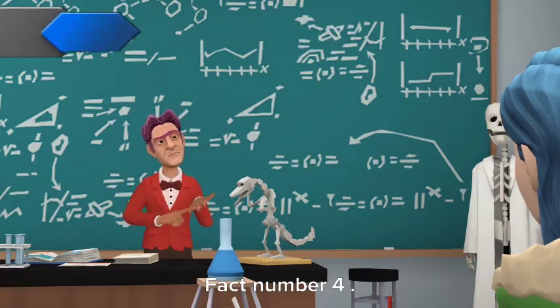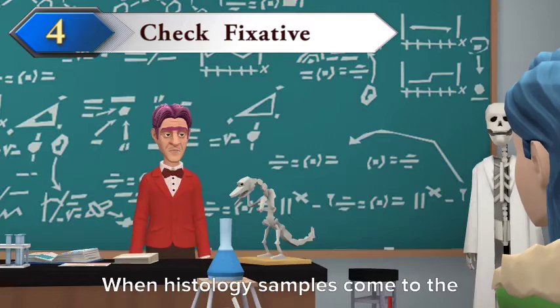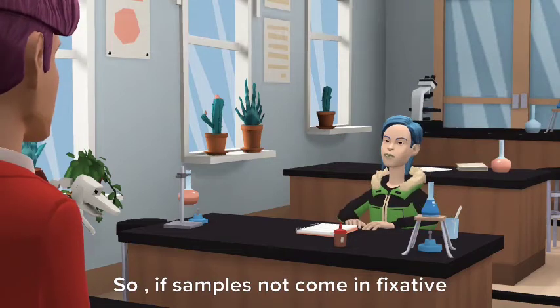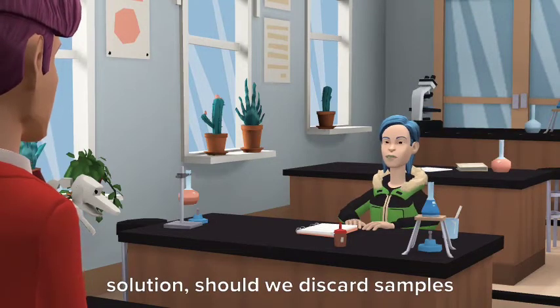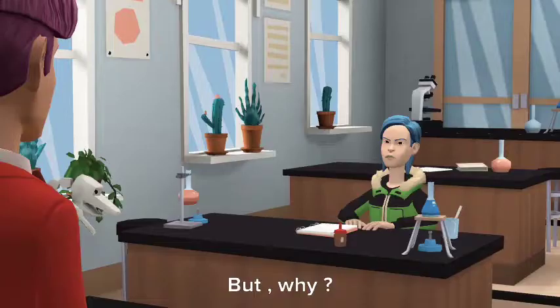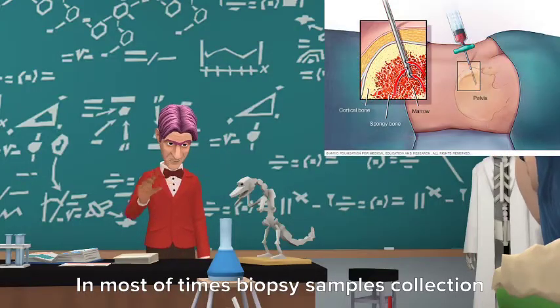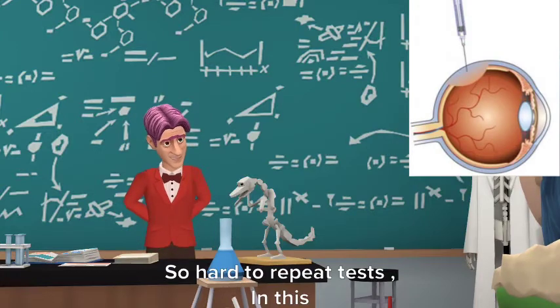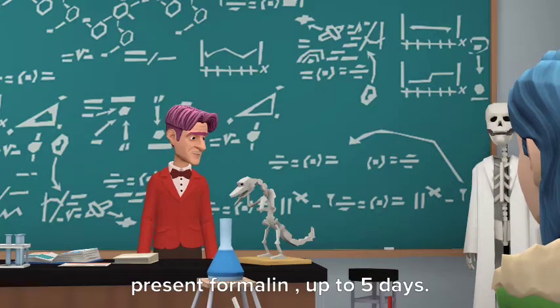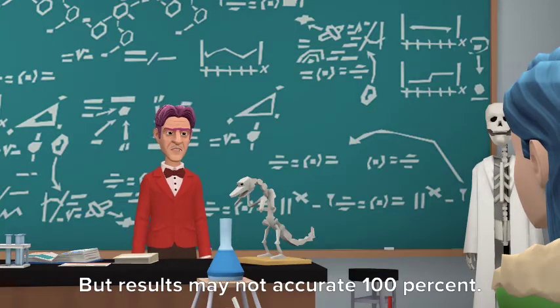Fact number 4: we should check whether a fixative is present or not. Histology samples should arrive in fixative solution. If samples do not come in fixative solution, do not discard them, because biopsy sample collection is invasive and hard to repeat. We should fix the specimen in formalin for up to 5 days, though results may not be 100% accurate.